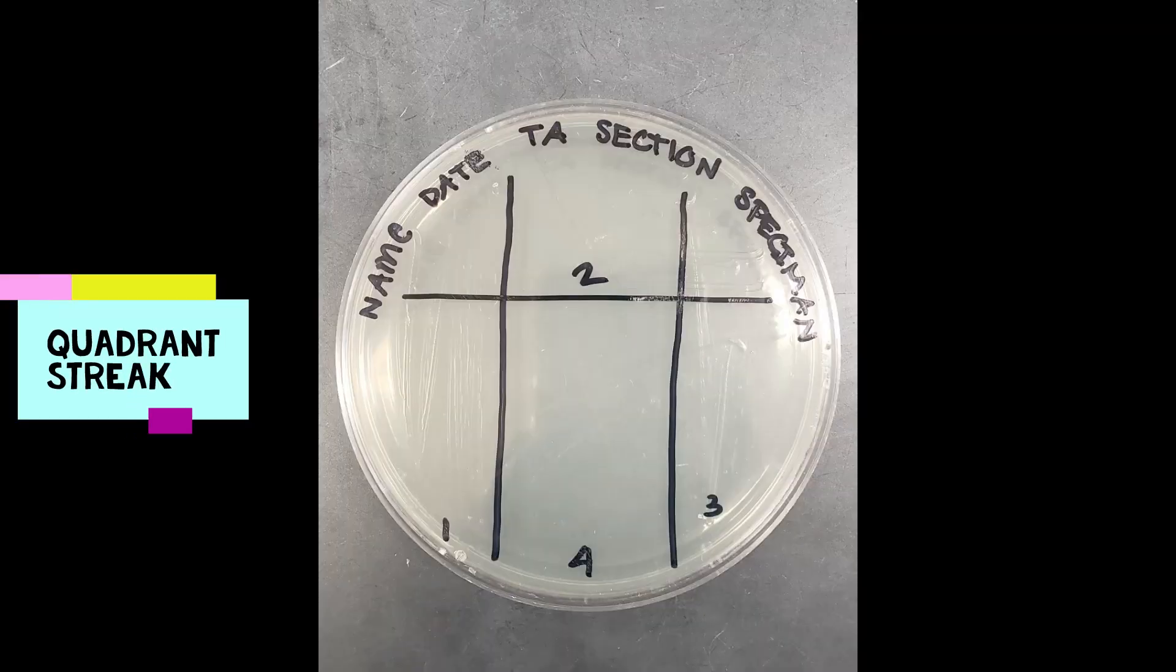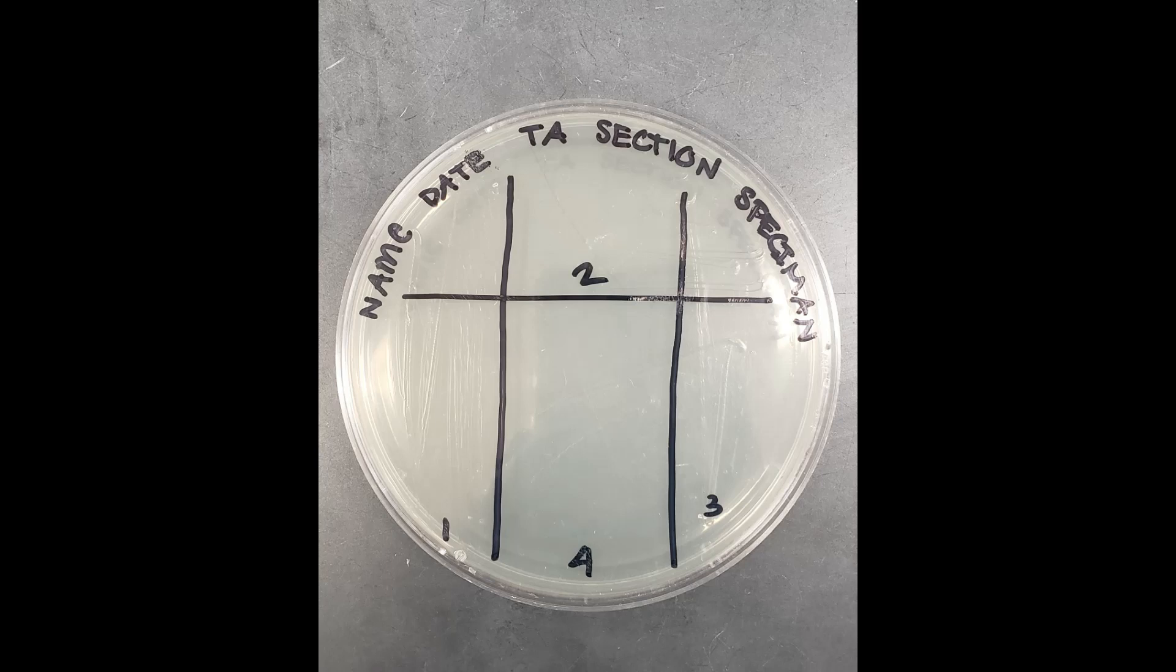Now, we'll quickly go over the other way that you've been taught, which is the four-quadrant method.